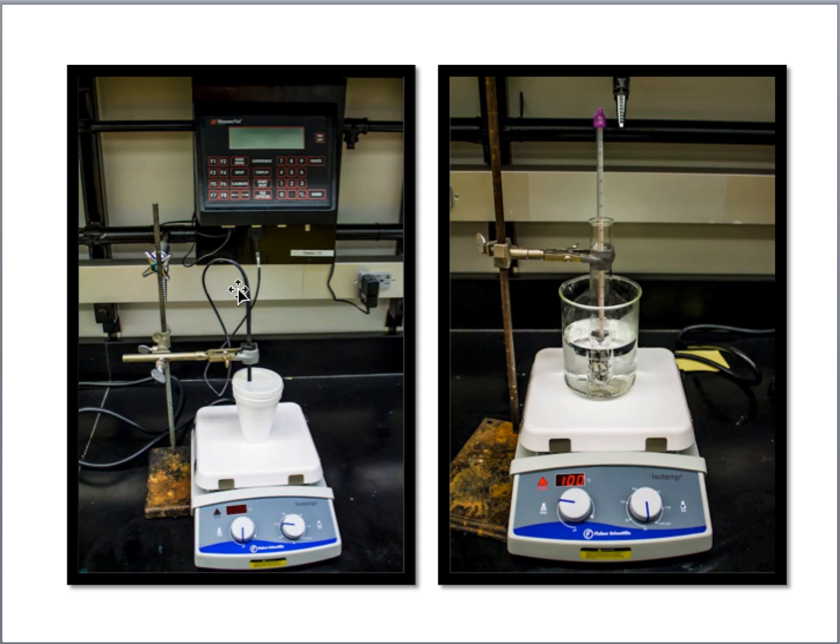Then you'll notice that we have a temperature probe set up that's hooked to our MeasureNet station. Now the station, using this temperature probe, will monitor the temperature as we go through the experiment, and it will plot data points very, very often, giving us beautiful data, assuming that you're performing the experiment correctly. So we've got our temperature probe in here monitoring the temperature of whatever's going on in the calorimeter. So when we're determining the calorimeter constant, we would have cool water in here, be monitoring the temperature, and then we pour in our hot water. The temperature would go up and then eventually stabilize at some equilibrium temperature, okay, and then we'd be done.